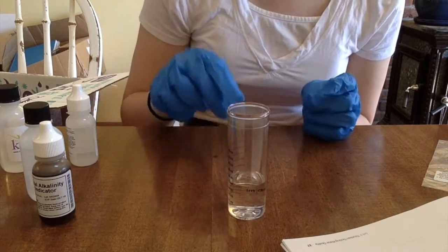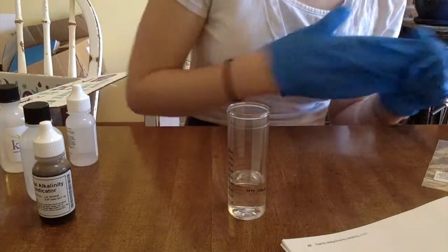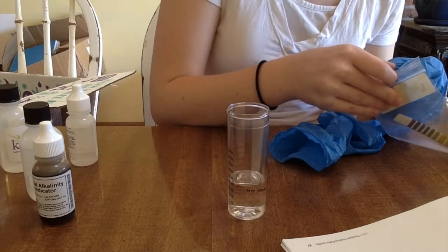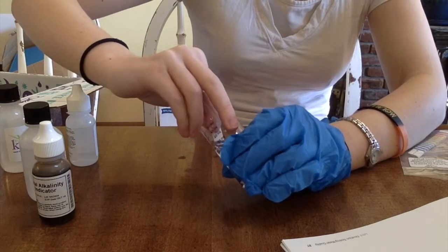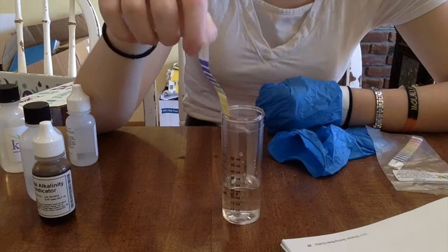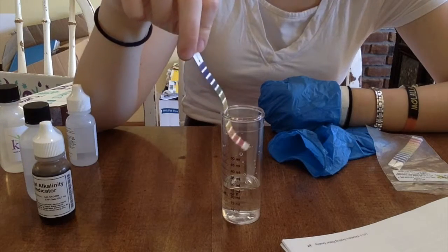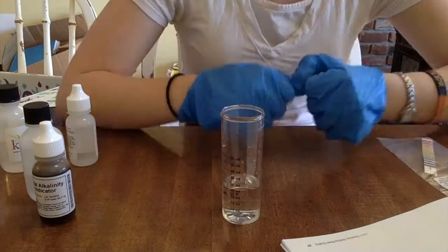So the sample is now down to 8.3. pH paper time, so we can check to make sure that it really is at 8.3. This might be a little bit lighter than 8.3. No, there it goes. It is. It's darkening.